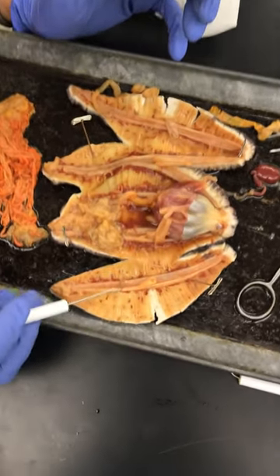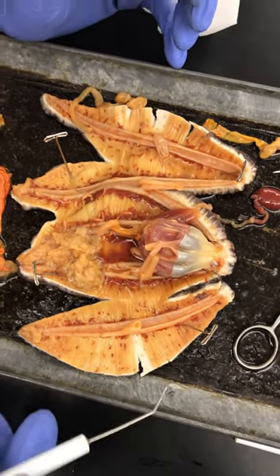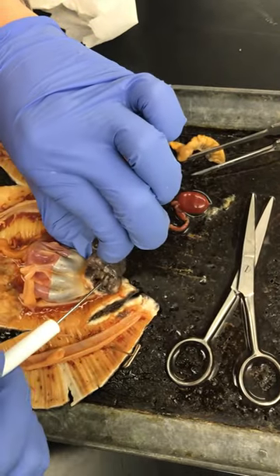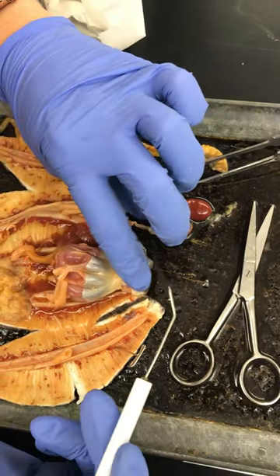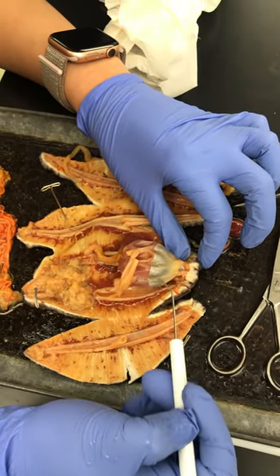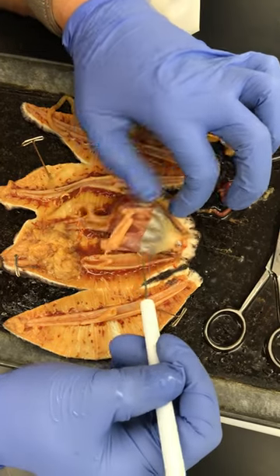So these little red things are the tube feet. Buccal tentacles should be in here, but it's like these things — I need to cut it open. The mouth is probably in there. Buccal ampullae are these lumps, kind of like a revolver gun thing.